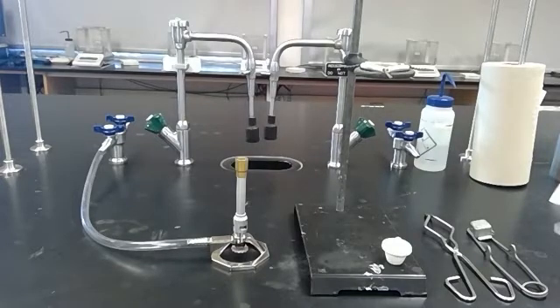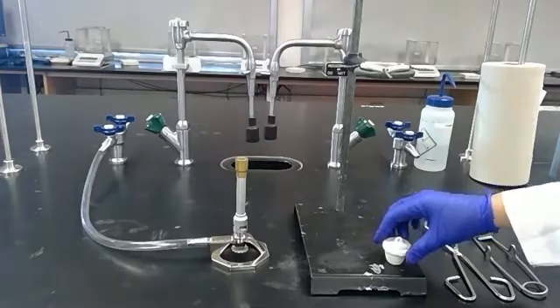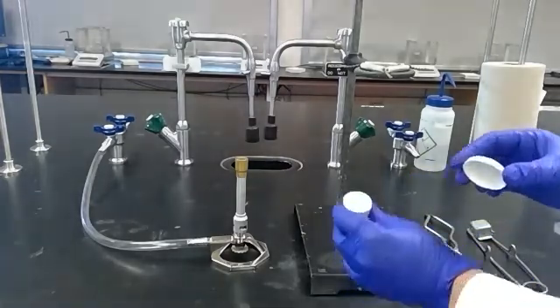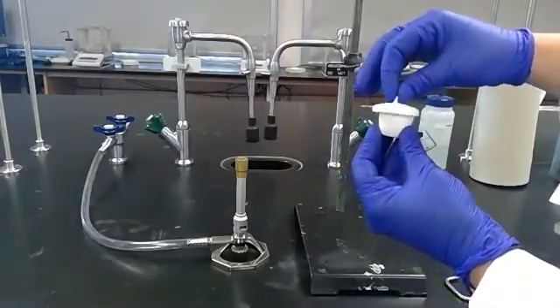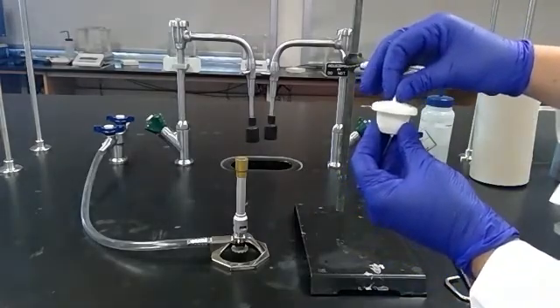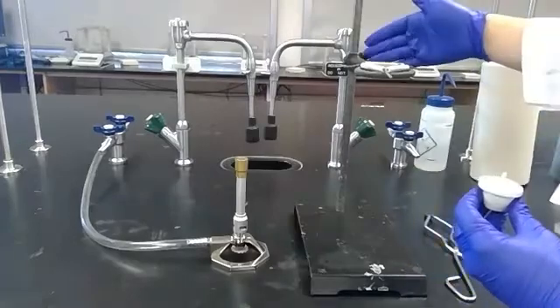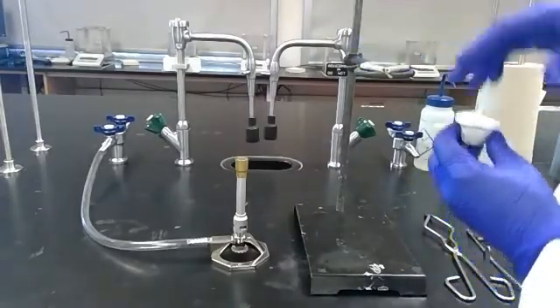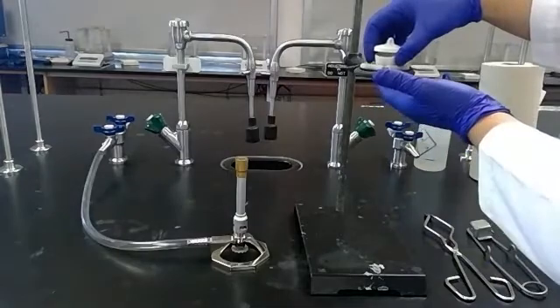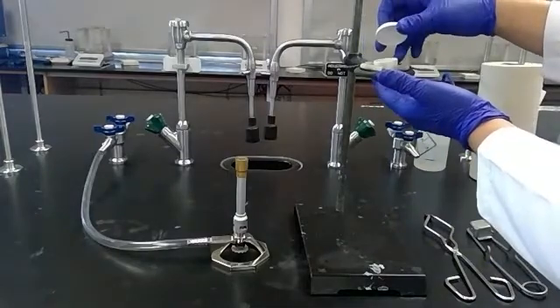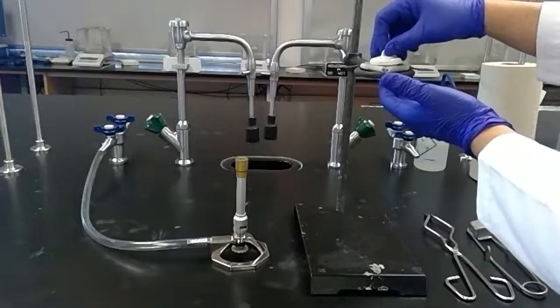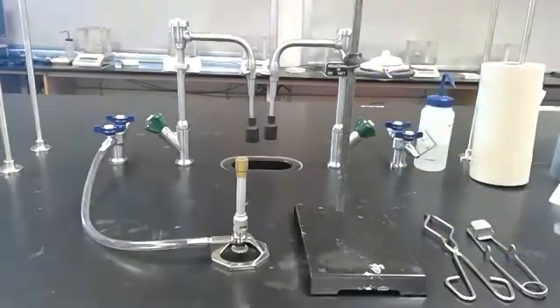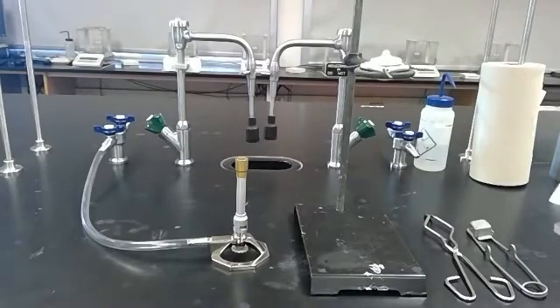We've measured out two grams of our mystery sample and placed it in a small crucible with a lid that doesn't fit tightly. We've set up a ring stand with a clay triangle to place our crucible in. We're going to tilt it a little bit to the side and place the lid loosely on it. This is where we're going to heat up our mystery sample and drive off as much water as we can to see what the weight of the dehydrated sample is.